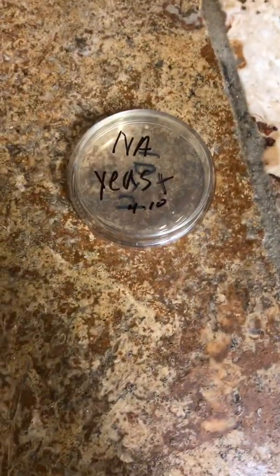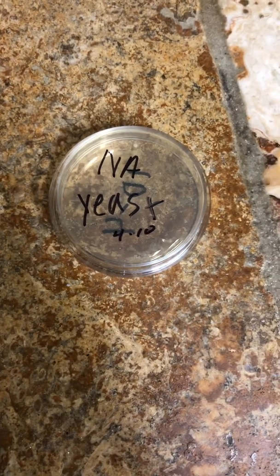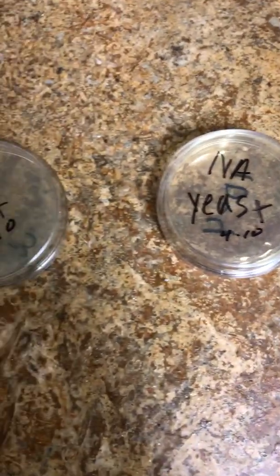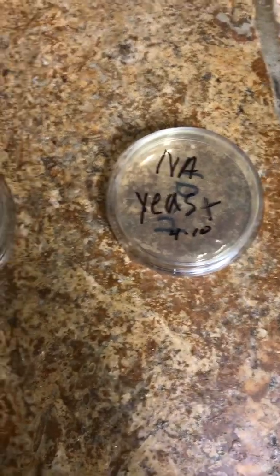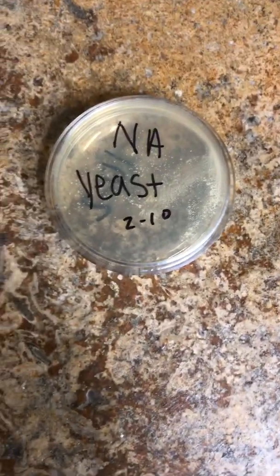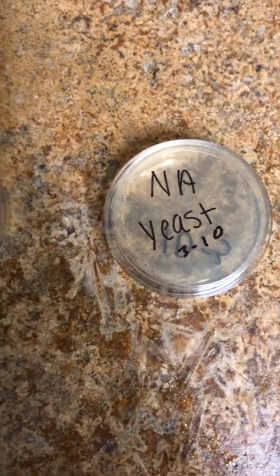And what's considered a viable specimen is a colony number between 30 to 300. That's also known as CFU, colony forming units. 30 to 300 is a viable specimen. Anything less than 30 is considered not viable, so they can't calculate the number of cells because the sample is too small. And anything over 300 is also considered not viable because the colonies begin to merge together, and the numbers are too large to calculate. So it has to stay between that range of 30 to 300.